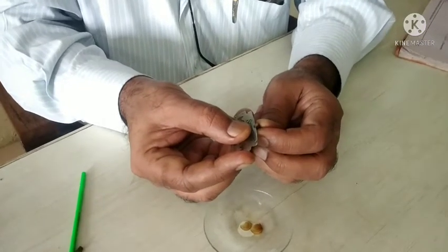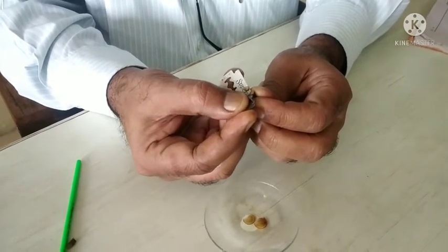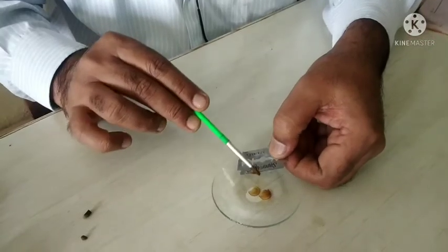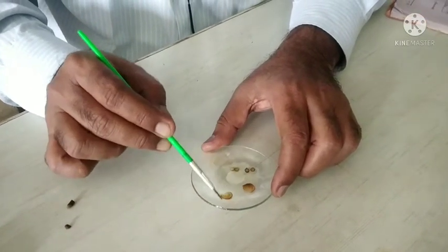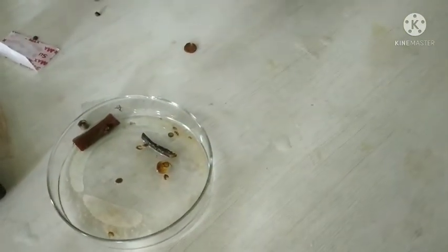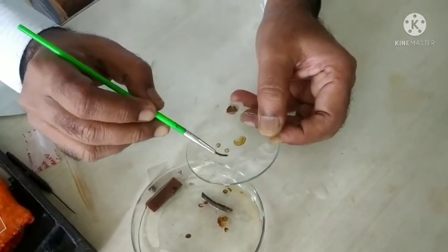This is a small root of unpeeled licorice. A complete circular disk cross-section is obtained by using a small root. With the help of a camel hair brush, transfer it to a watch glass containing water, which is used as a cleaning reagent. Select thin transparent, complete sections and discard the remaining. Clean the selected sections using water and remove any fibrous material and debris present on the section.